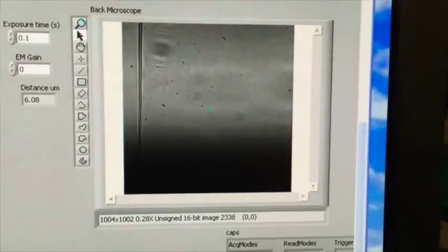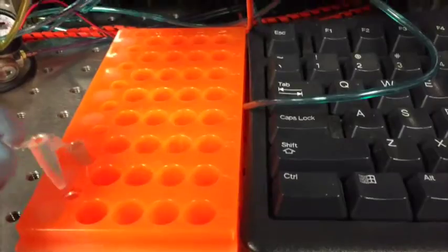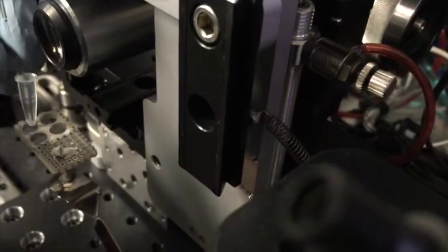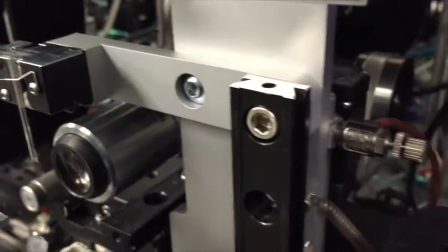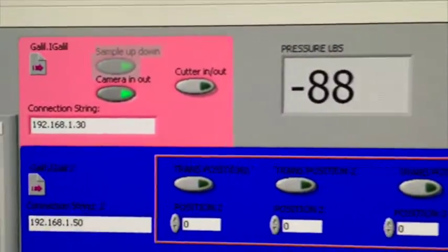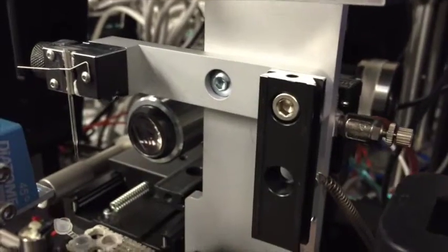So now I'm going to dip. And take my polylysine and place it into that front left corner right there. See, I can't move this arm right here up and down because the camera's in the way. So I'm going to have to take the camera out of the way. I go up here to the top and I go camera in, out. I want it out. And now the camera is not in the way.